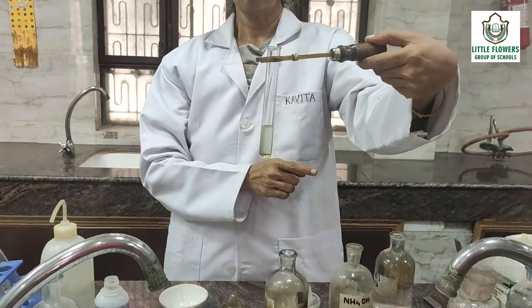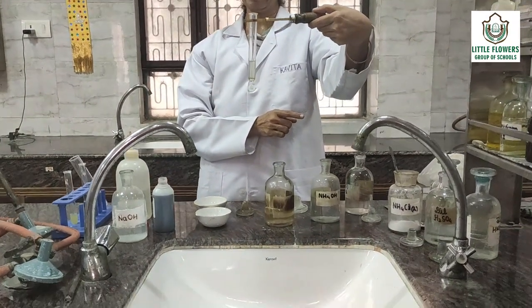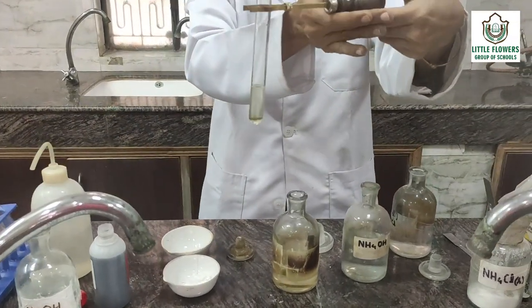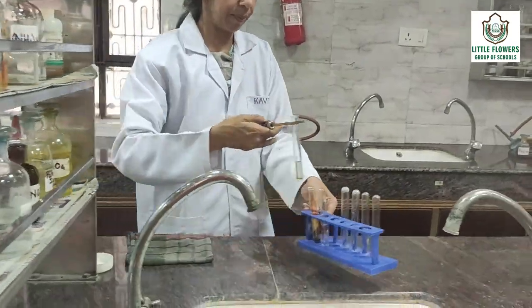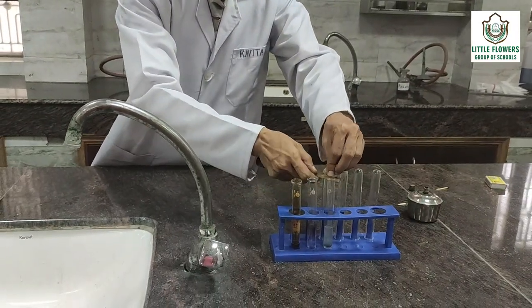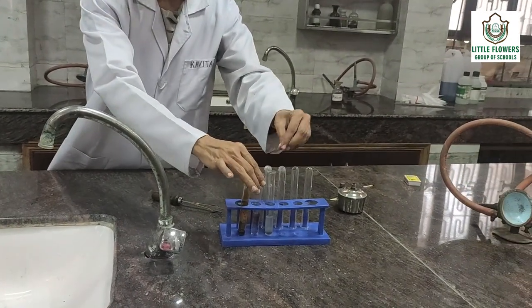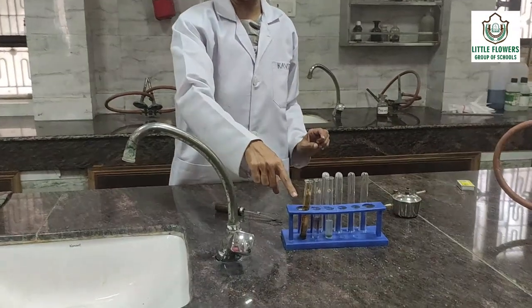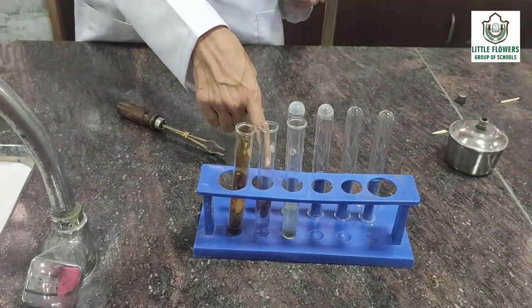So we can see in the given salt, aluminium as the cationic radical and nitrate as the anionic radical is present. Now see the confirmatory test of both. For aluminium — after adding reagents, the blue gelatinous PPT was there. For nitrate — the brown ring was formed. This is my wrap. Thank you so much, bye.